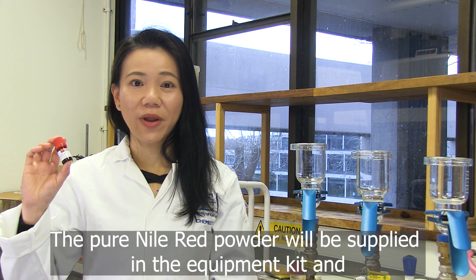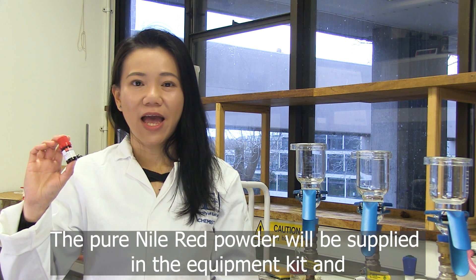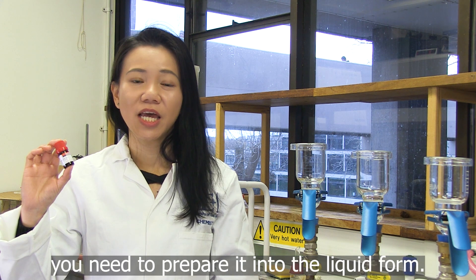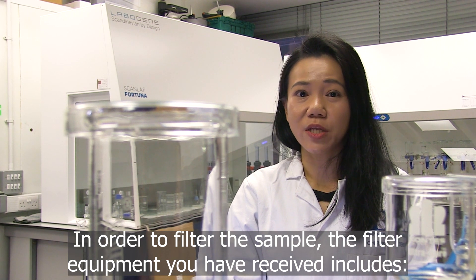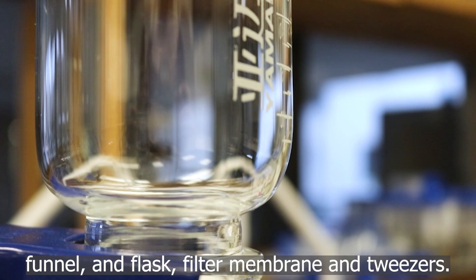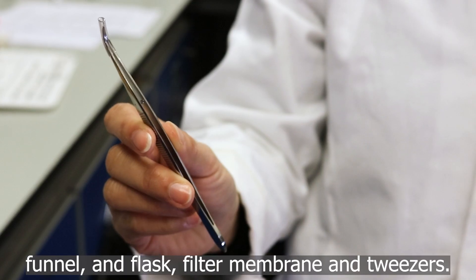The Nile red powder will be supplied in the equipment kit, and before your sample processing begins, you need to prepare it into liquid form. In order to filter the sample, the filter equipment you have received includes a filter funnel and flask, filter membrane, and tweezers.